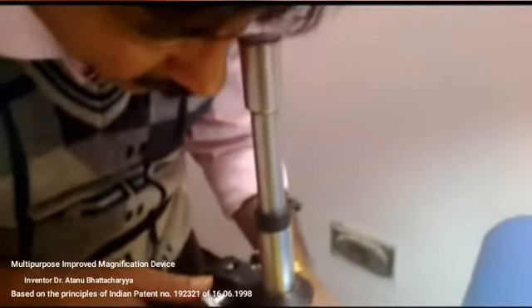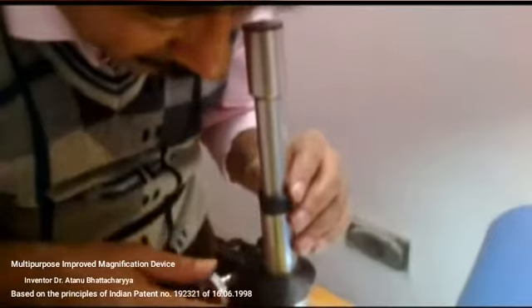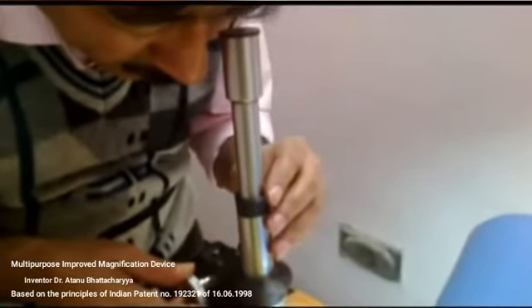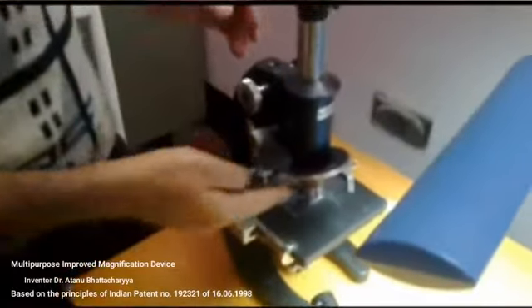Then again it is being adjusted. The light adjustment has also been done. Now the magnified image is being seen. Now I am trying to show you the view through the device. This is the highly magnified view, about 1200 times magnified view. It is 1200 times magnification by using the 40x objective of the microscope.